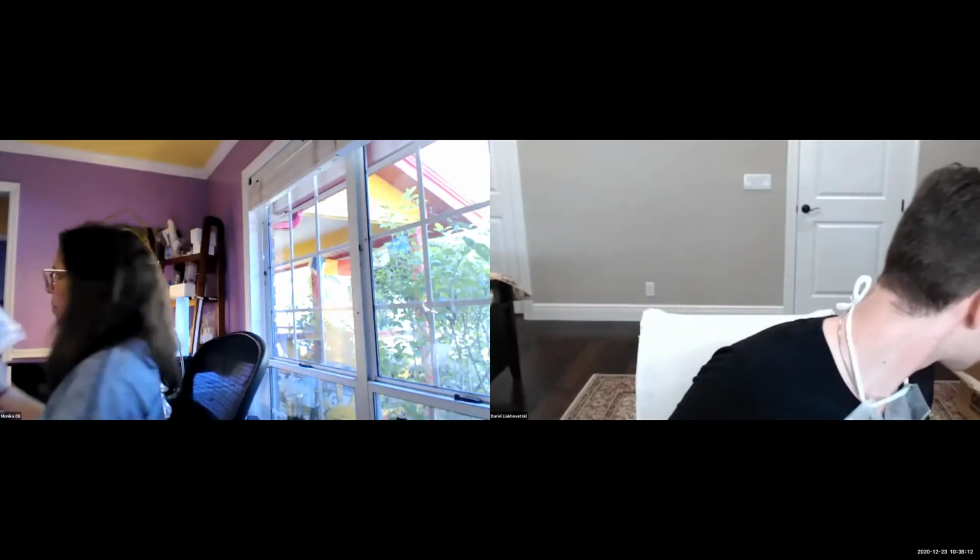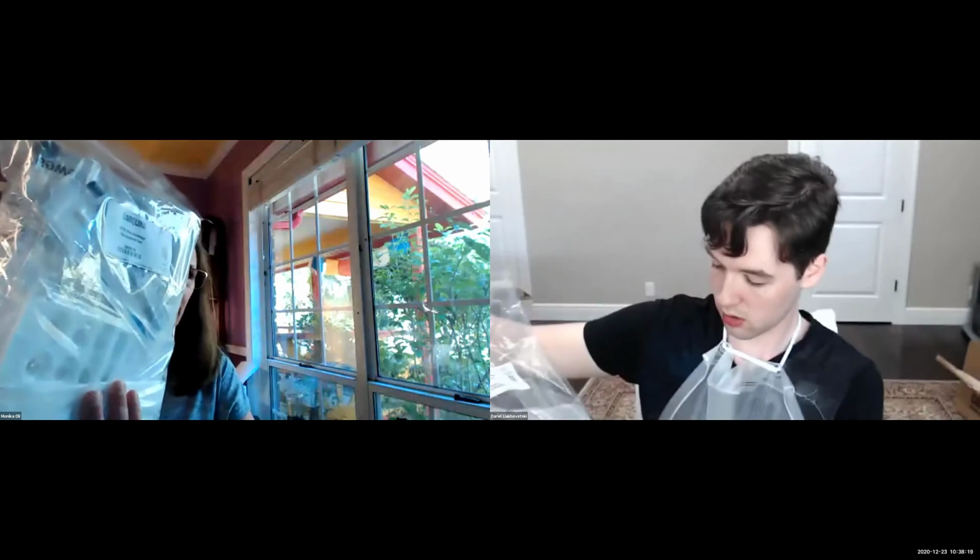But in which bag would that Bunsen burner be found? That would be in the large bag with sort of everything, with the PPE and the pipettes and everything else. It's usually in here. And you also can see the tube rack in here. Yes, okay. It's a little paraffin candle with a wick. If you take the lid off, it's just like a little light.